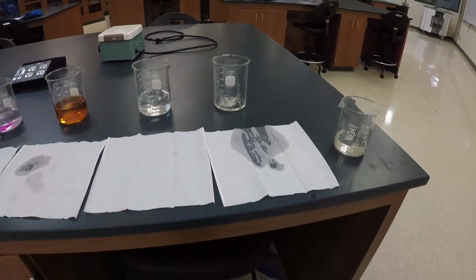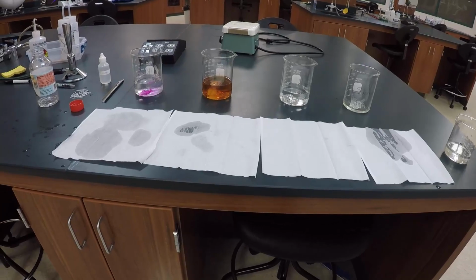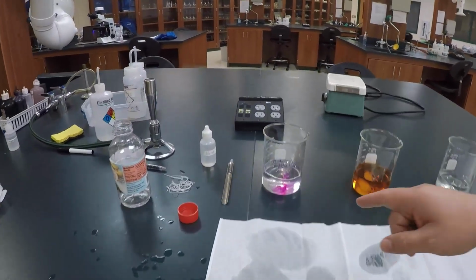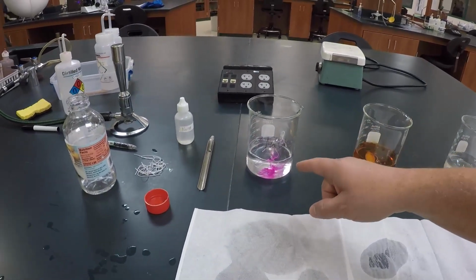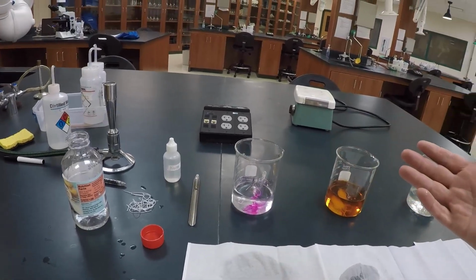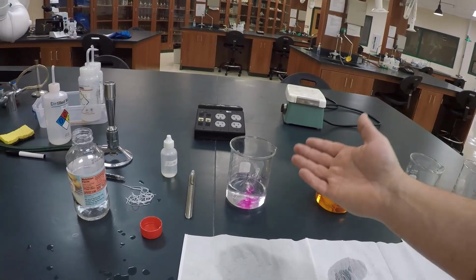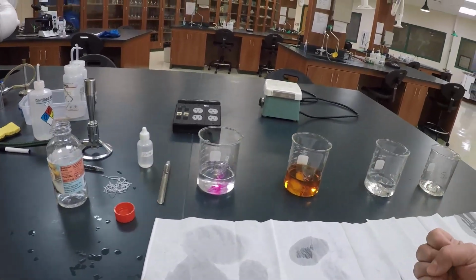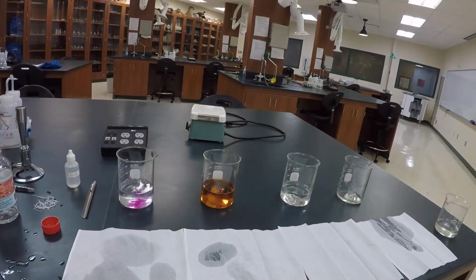Okay, we're going to give it roughly 30 minutes, and then I'll come back and show you the end results. And I assure you, you can see this one as it is right now. I'm going to redo this one because that bag is leaking, so it might have a hole in it. So I'm going to redo it, so you're probably not going to notice all the pink spilling out of that bag. At any rate, I'll bring it back and show you the end results.